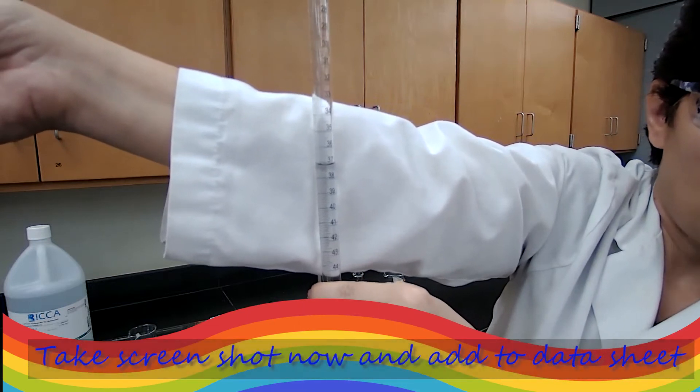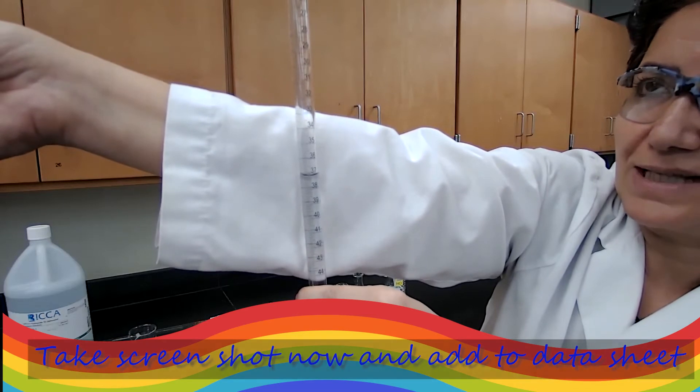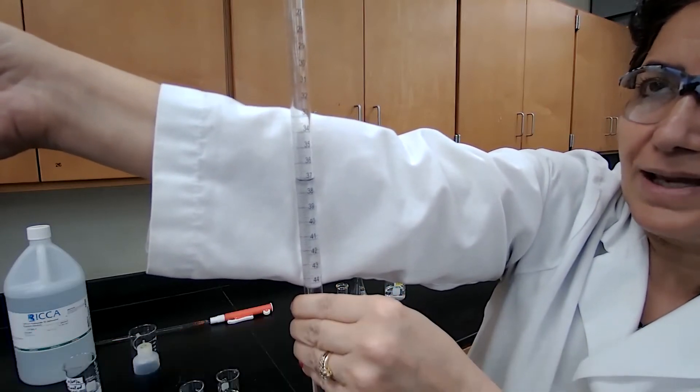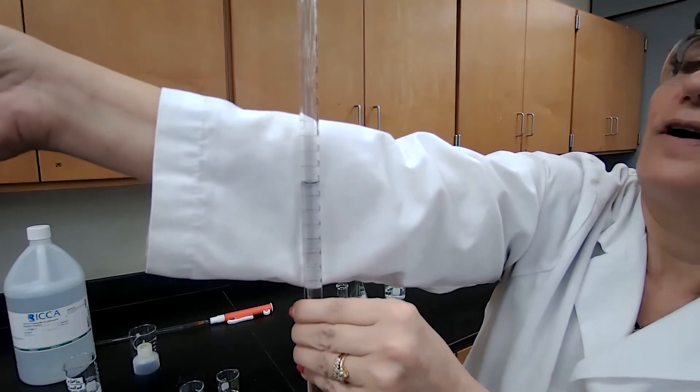Record the number. This is the final reading for second trial of titration of saturated calcium hydroxide. Initial reading was 10.00 and you have the final reading.